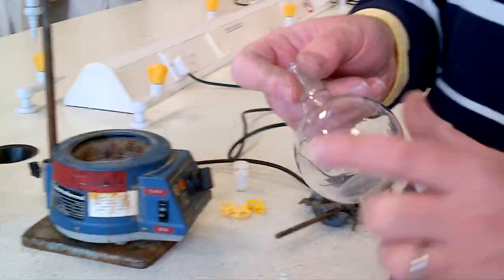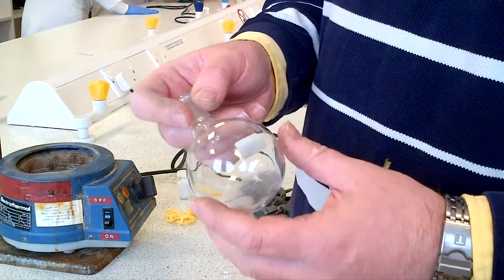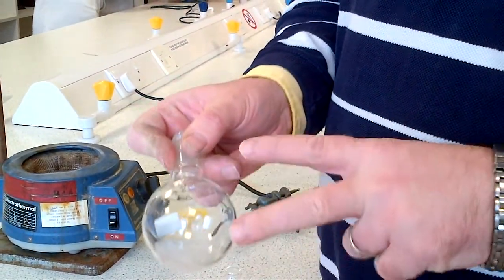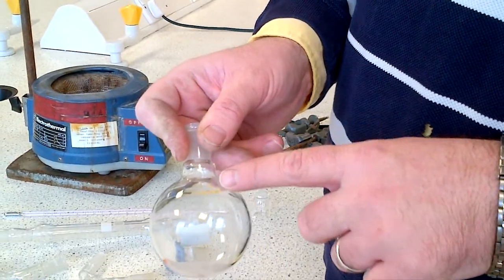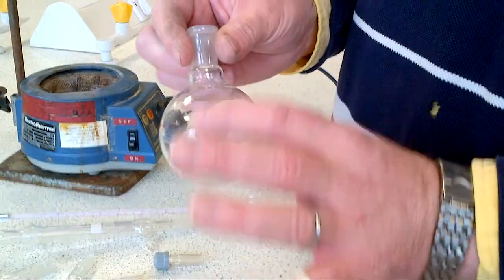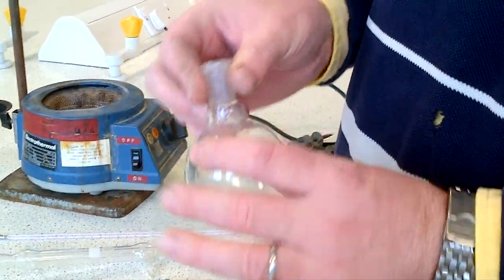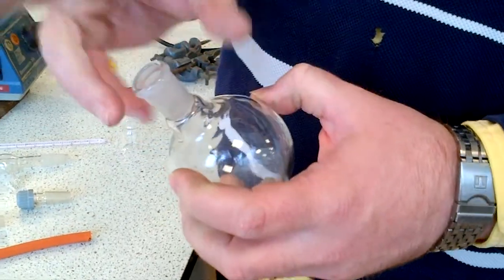You'll have your solution or organic material in the flask. The first thing to say is that the flask should be no more than two-thirds full. This is a 100 ml flask, which would take a volume of at most 65 ml. Make sure the neck of the flask is clean with no organic material on there.